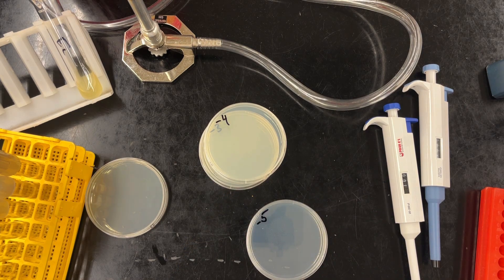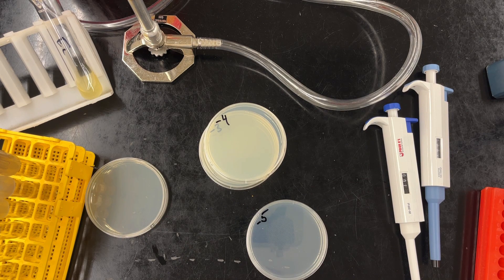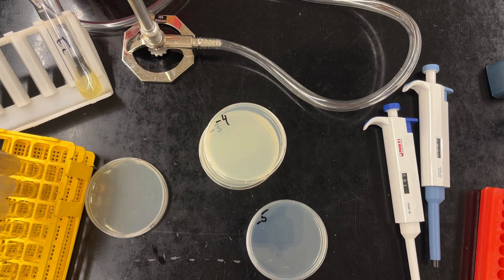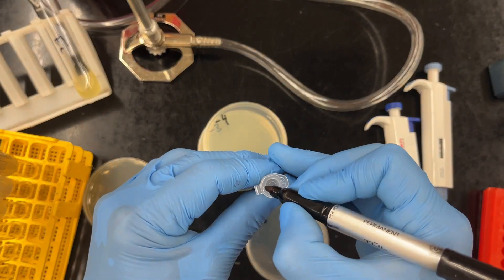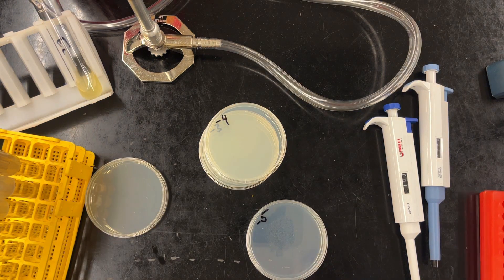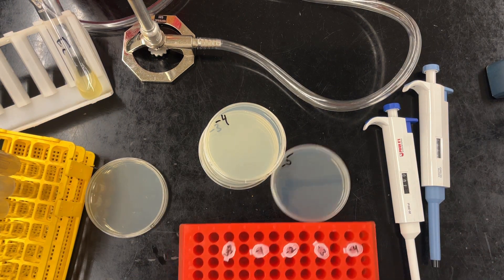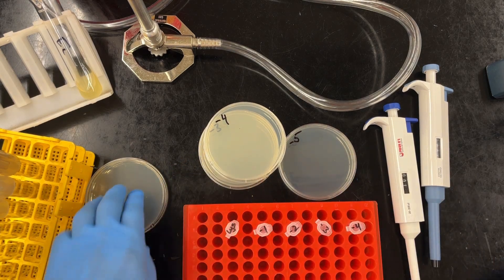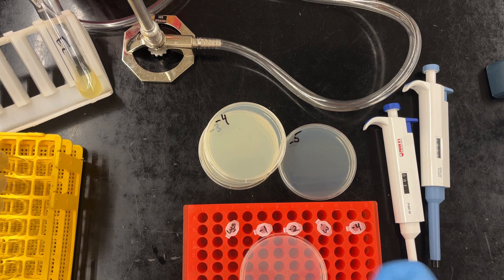It's at this point I decided I need one more dilution tube. So here's my tube for my minus four dilution so then I can have my minus five plate. And I think I also wanted to do a control one where there's no bacteriophages. So my fifth plate I labeled as control.